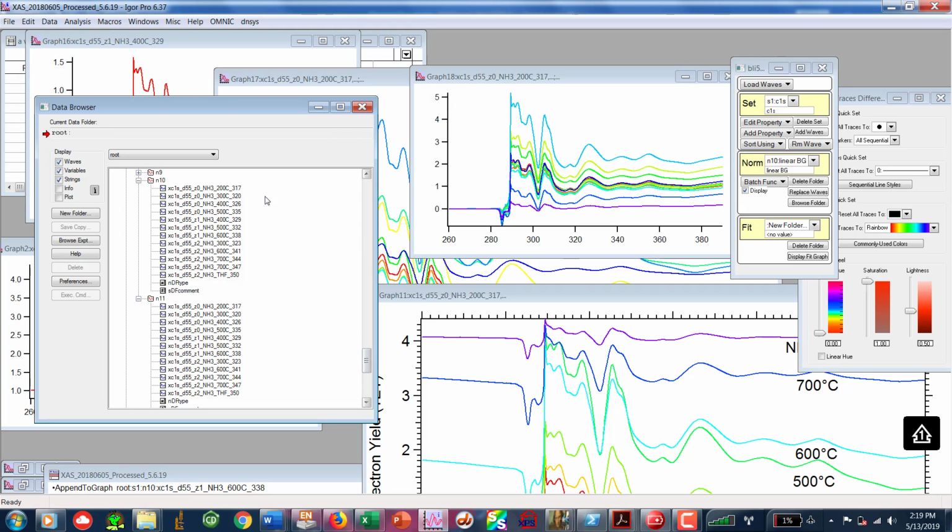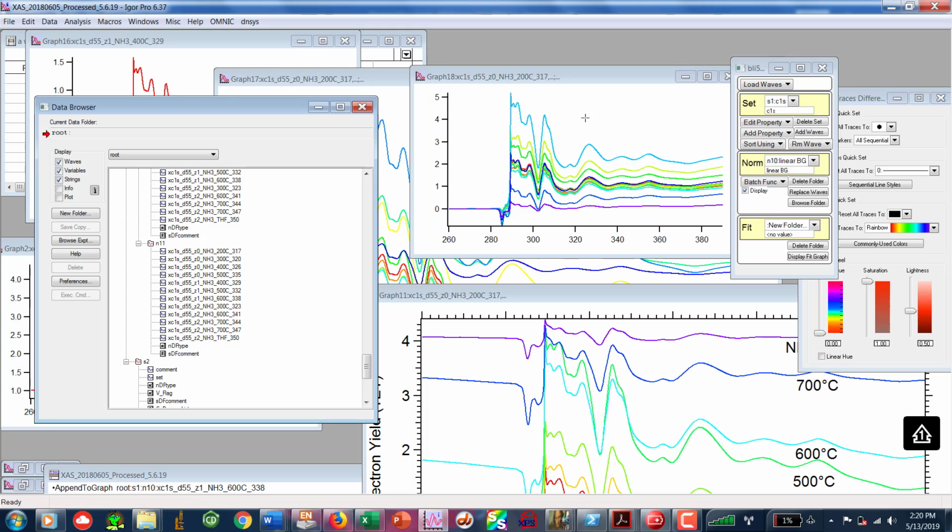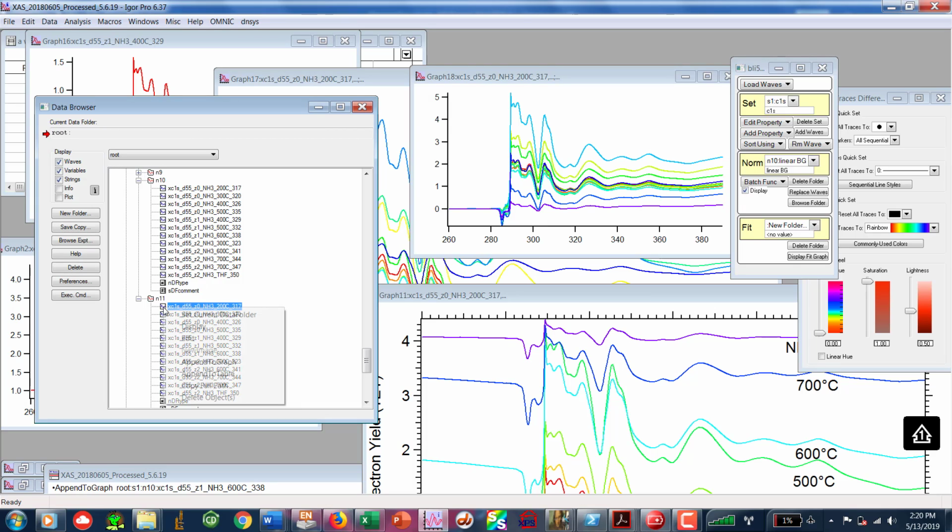And what I did is I took your interpolated set, I downloaded it into a new file folder. So I just called it N10 LinearBG. But then I knew that this couldn't necessarily work properly, so I made a new one called N11, which also had the reduced data set in there. So the same things that you see right here after the background are in N10, but then I'm about to do N11. And you'll notice that as I display the data set, it's not background subtracted.